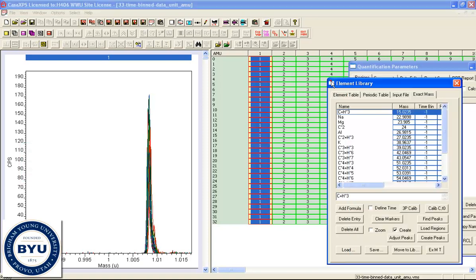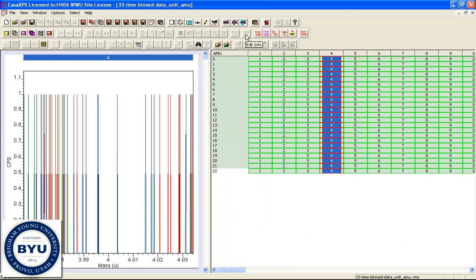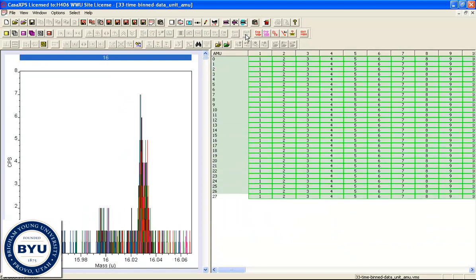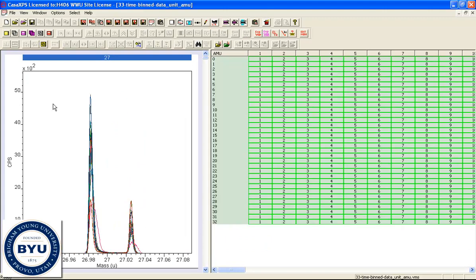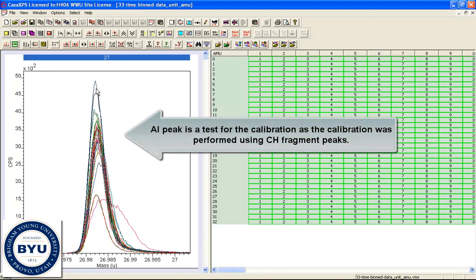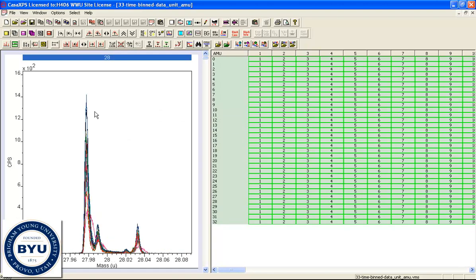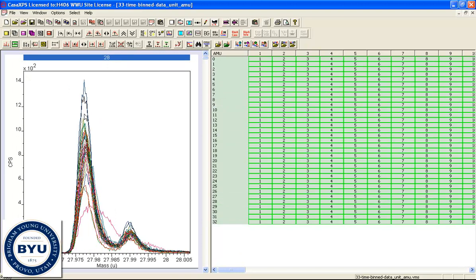And let me just close the element library and the other dialog window, and then we can step through and see how these peaks appear. So that was 15. That's 15 aligning. This is an aluminium peak. So we're calibrating based on hydrocarbons, and you can see that the aluminium peak has lined up very nicely, with the exception of one of the measurements which has a greater uncertainty in the mass. And this one is a silicon peak. And again, that mass calibration has aligned these peaks quite nicely, apart from where there's a clear problem with the data.